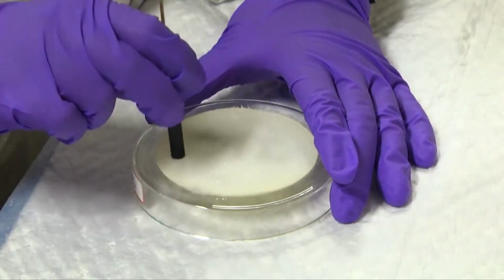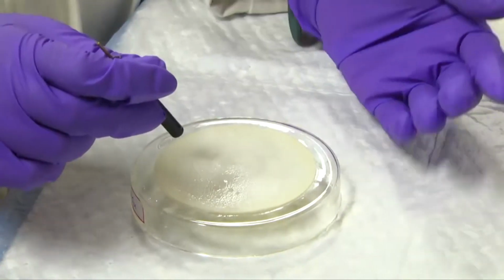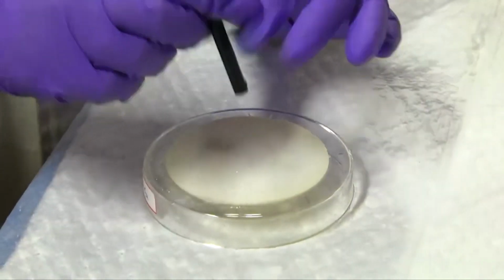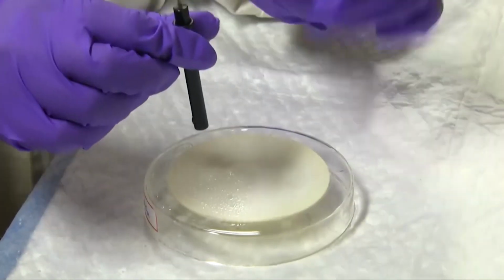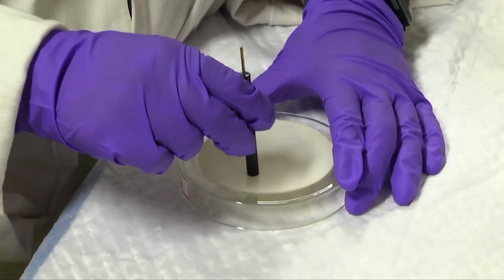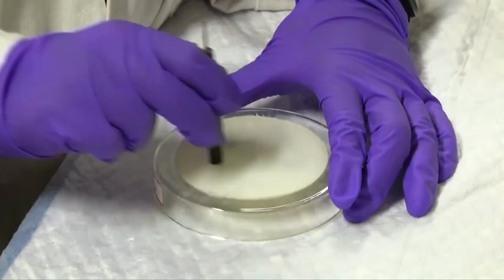While making 8, according to the different kinds of shapes that we have tested, it is widely concluded that the 8 shape is the best form of cleaning the electrodes. Another thing we need to keep in mind is that while cleaning we also have to rotate it by 90 degrees to ensure that every portion of the disc electrode is being cleaned. Like this, then slowly rotate, then this, then slowly rotate, then this. So doing this several times.